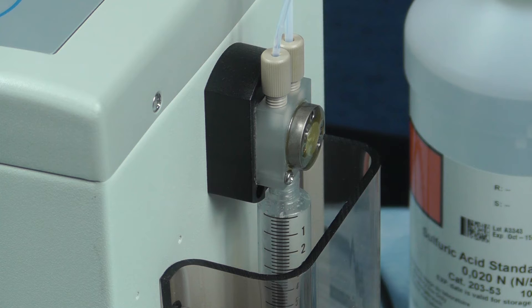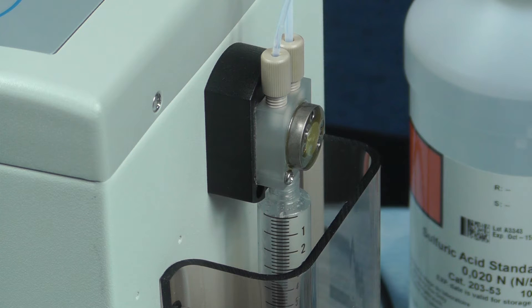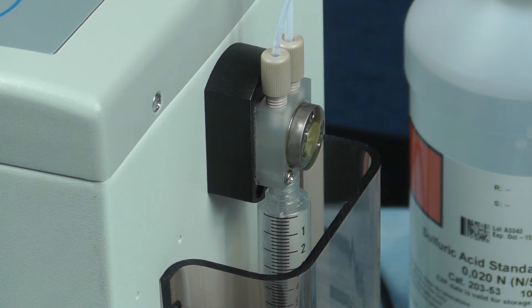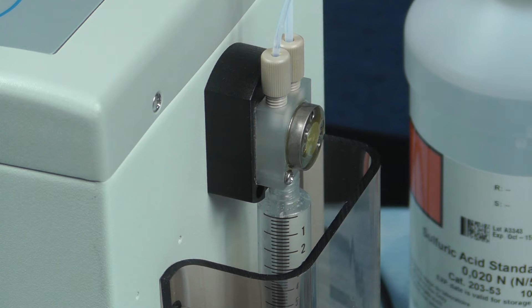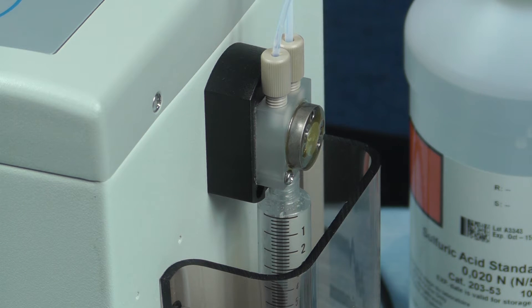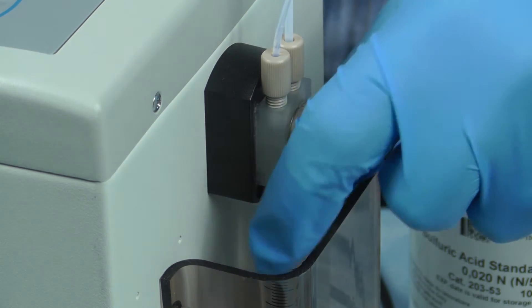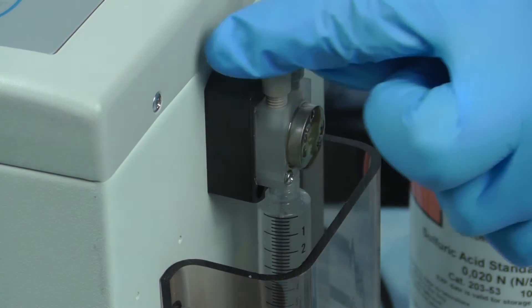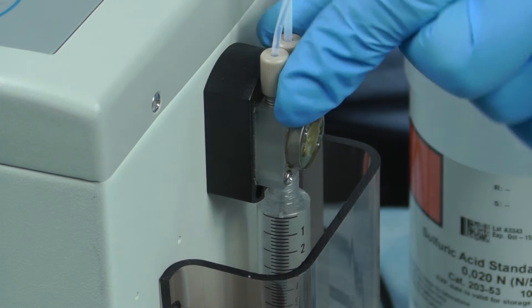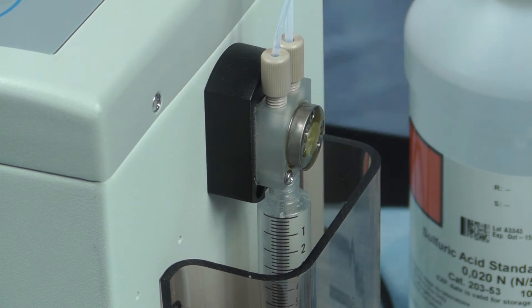Before beginning the first analysis of the day, you will first need to prime the syringe with titrant. This should be done once a day to clear air bubbles and ensure fresh titrant is in the tubes. Make sure all fittings and the syringe tip are tight.